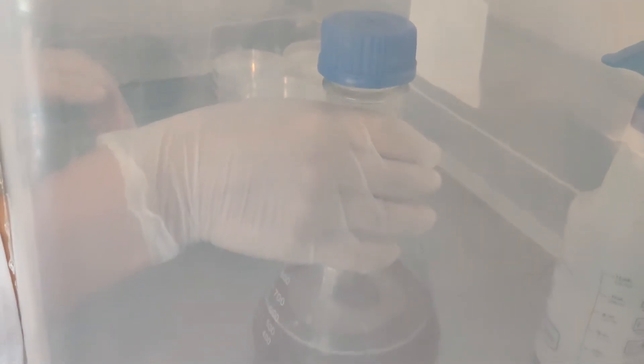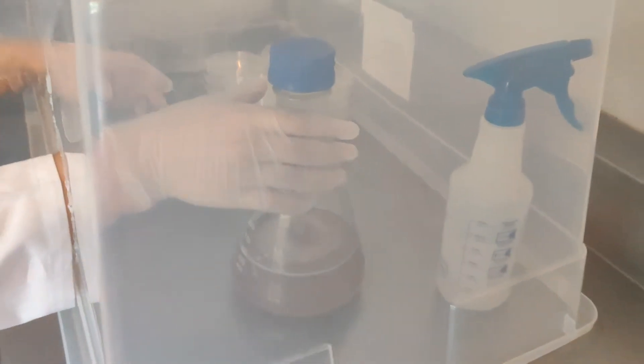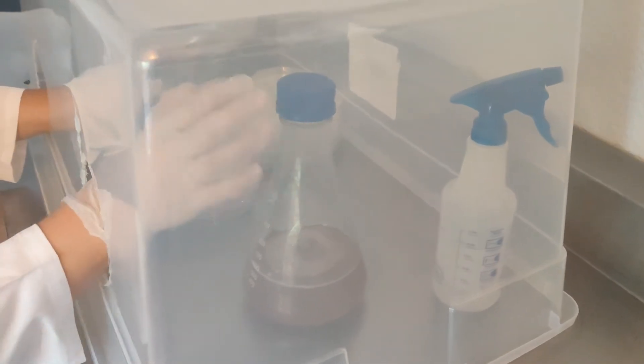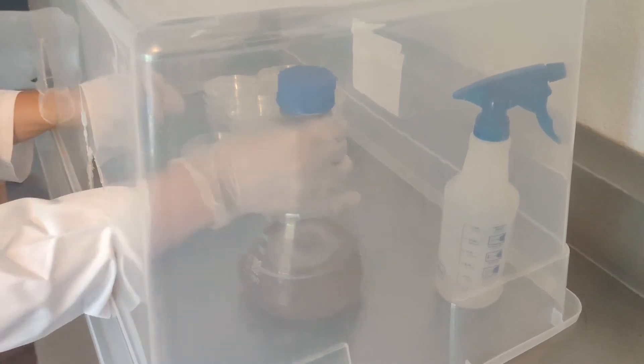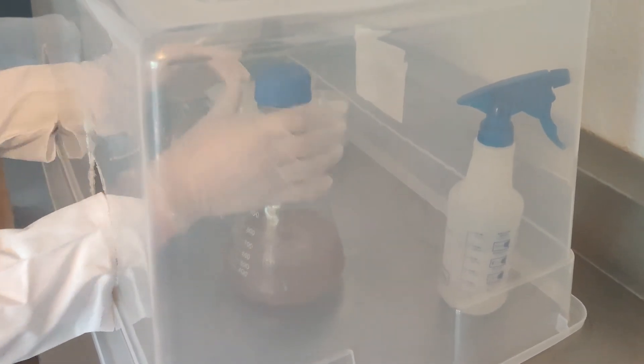After your agar solution has cooled for about an hour, you're going to set everything up in your still air box or in your sterile space. Give your agar a good stir.